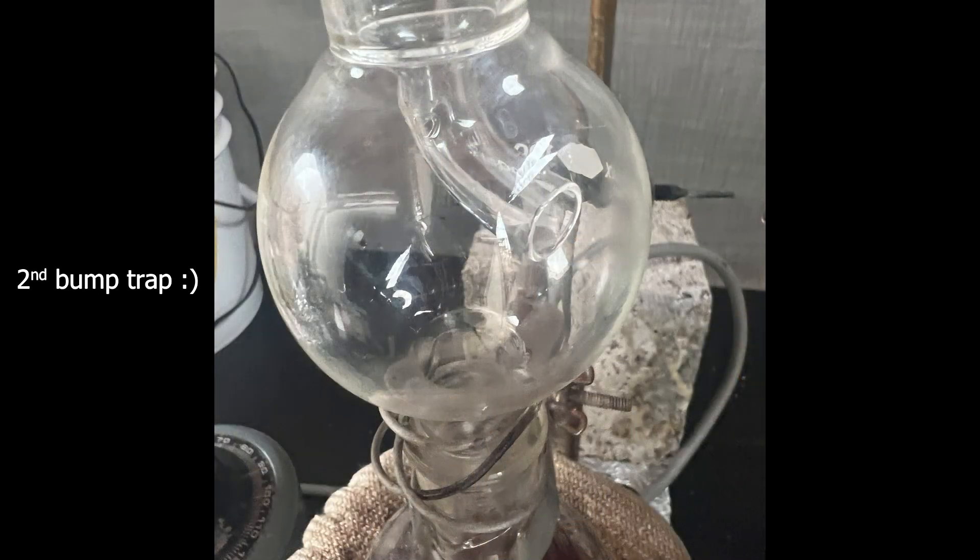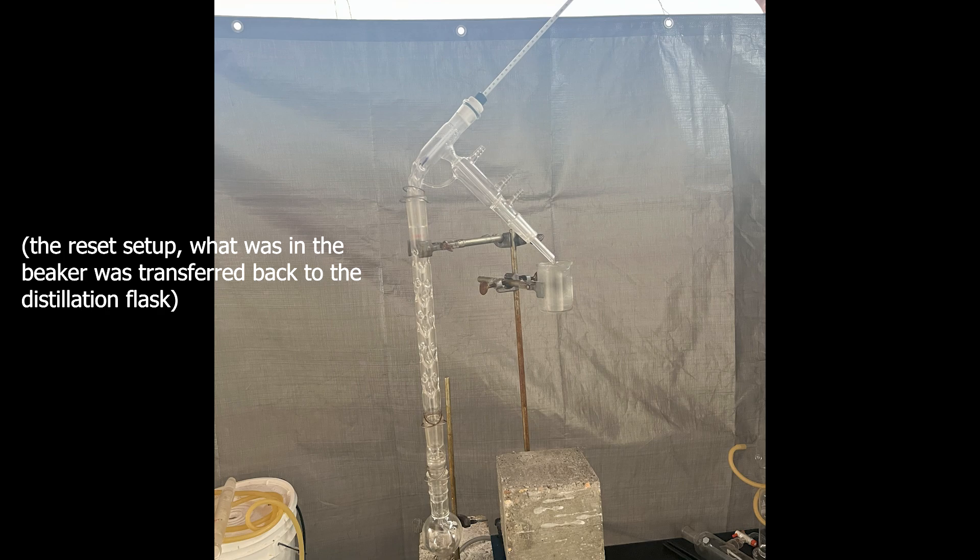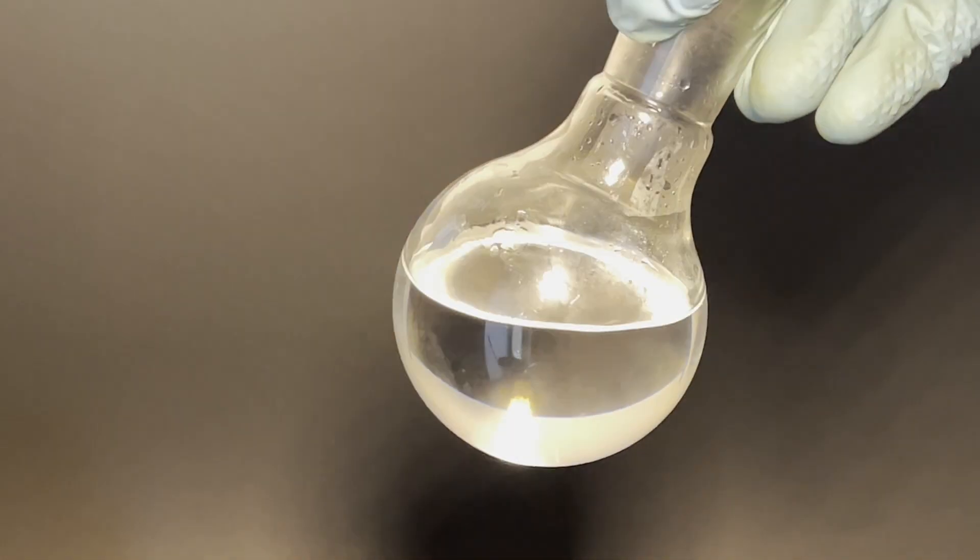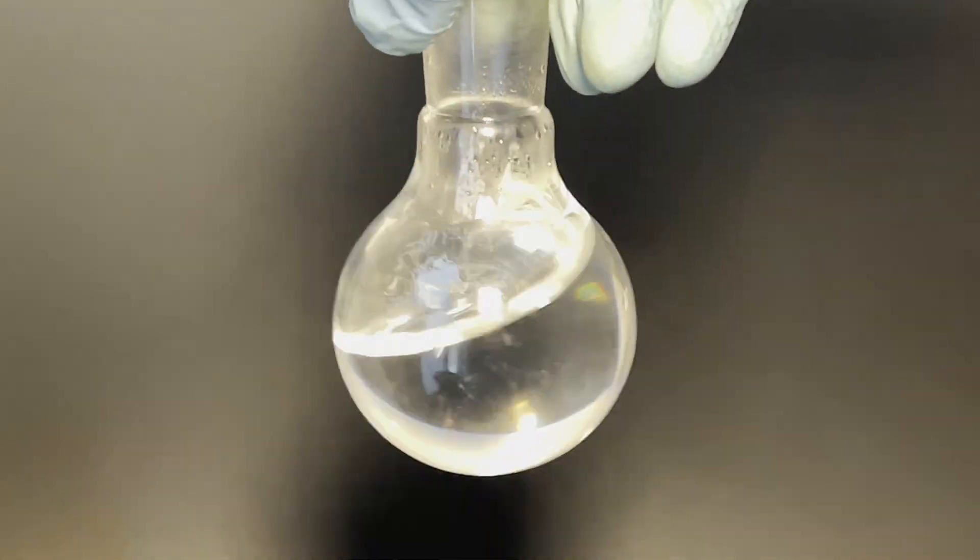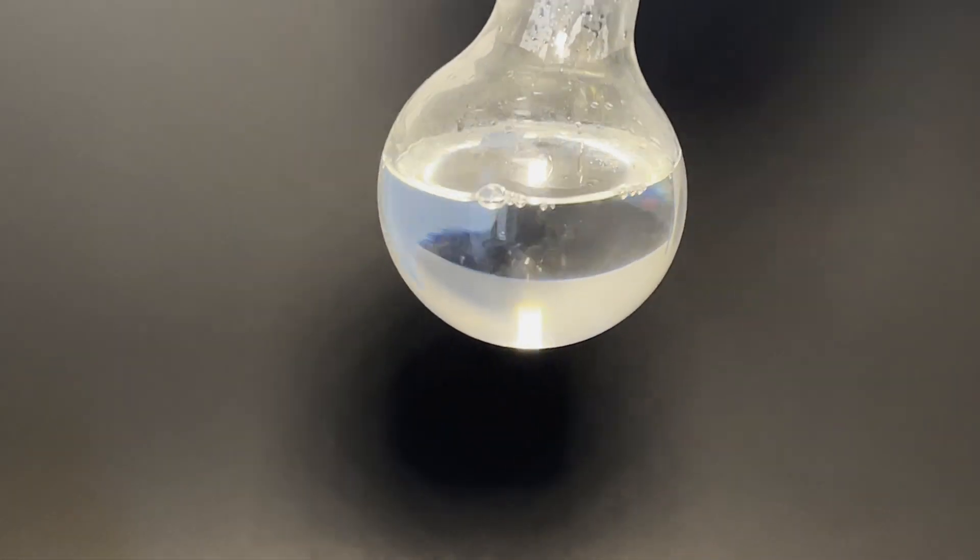During my first attempt, I left the distillation alone for not even five minutes and it foamed enough that the mixture was blown all the way through the apparatus. After all that, here's what I ended up with. A crystal clear, refractive, and dense liquid.